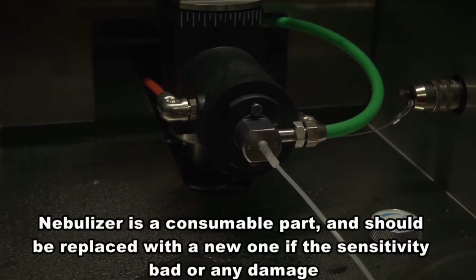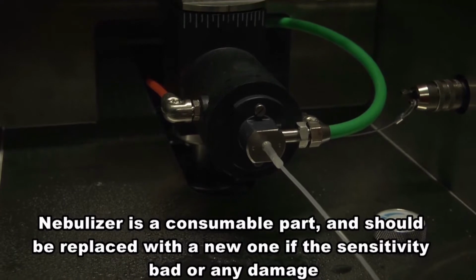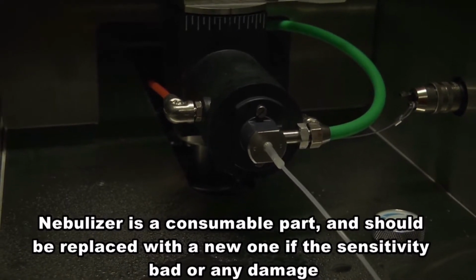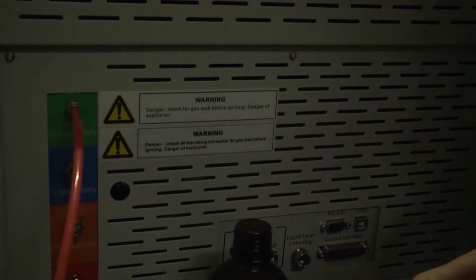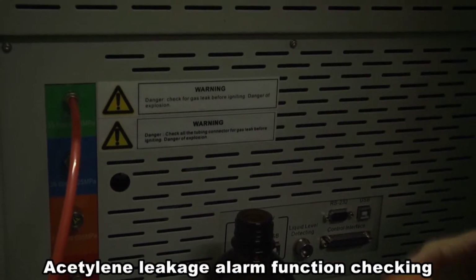When the sensitivity of the nebulizer is not good enough, you should either adjust the nebulizer or replace it. Please make sure to do the safety checking every 1 month.